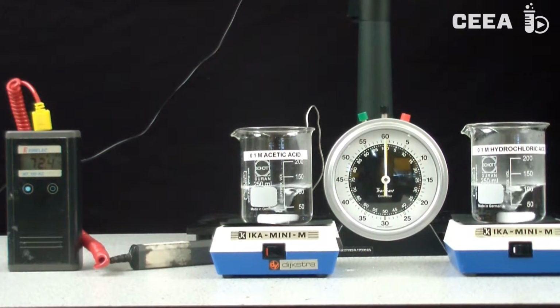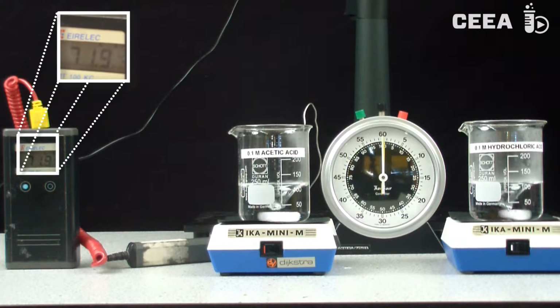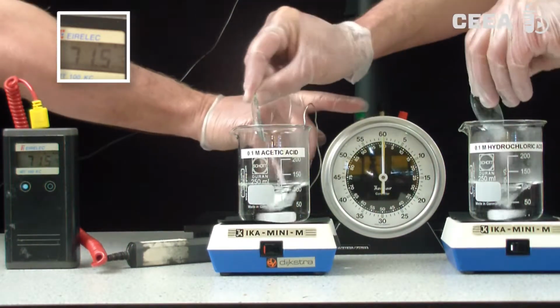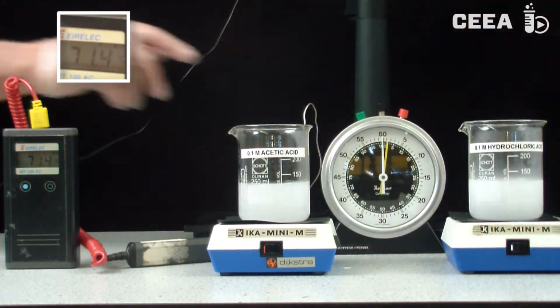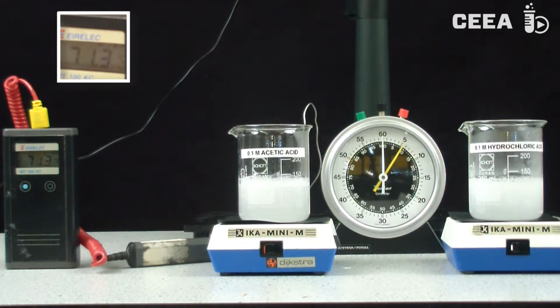The second experiment is carried out at elevated temperature. The reaction looks more spectacular now. The rate, however, turns out not to be drastically higher than at room temperature. The observed bubbling can be ascribed to reduced solubility of carbon dioxide at higher temperatures.